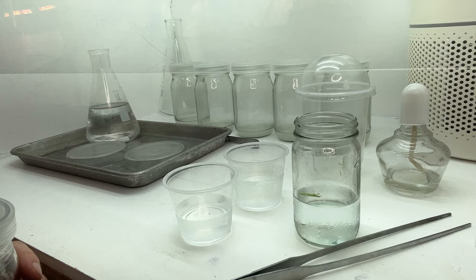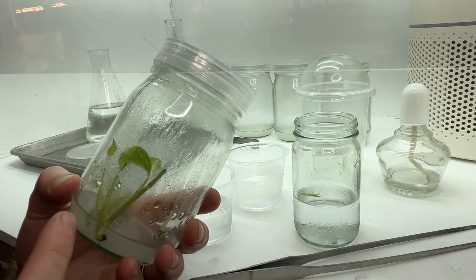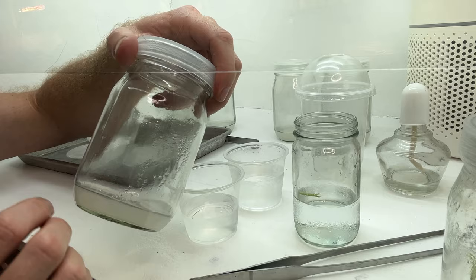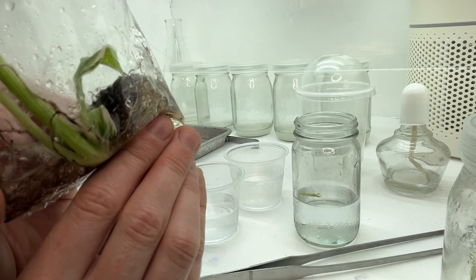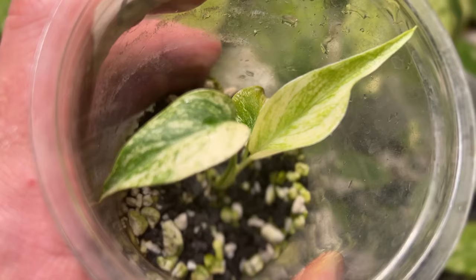Once these plants are large enough to be subcultured, they'll be cut again and put into a new batch of fresh multiplication media to be grown out again — cut potentially an infinite number of times — where they'll eventually end up in a rooting solution, creating many different branches of rooting, all while in a sterile environment.